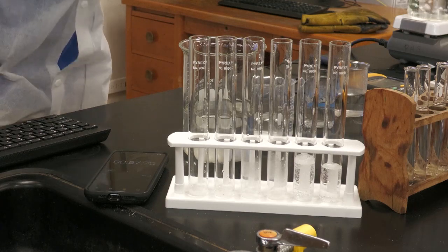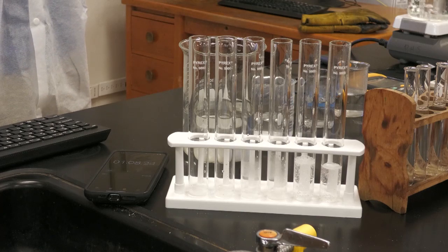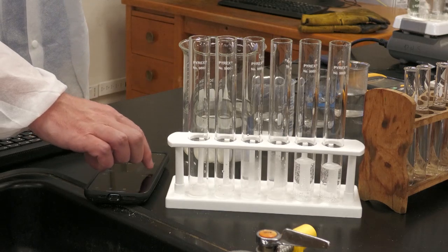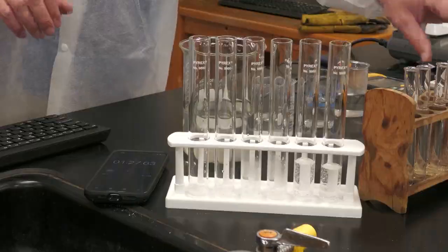When we stop hearing it is when we're going to stop the timer. Okay, that's pretty much stopped. We got about 127.